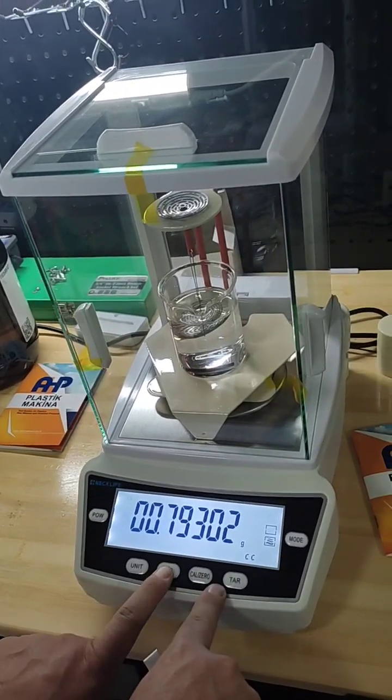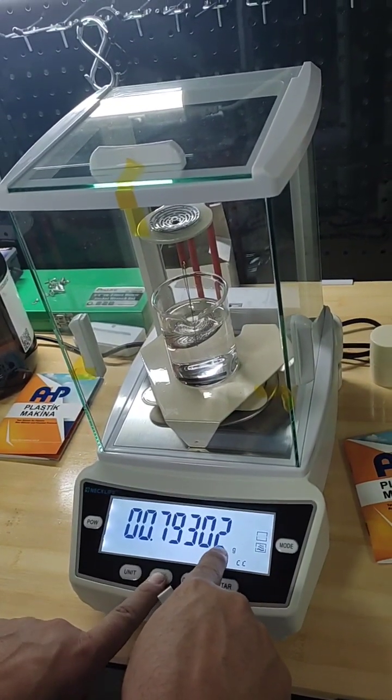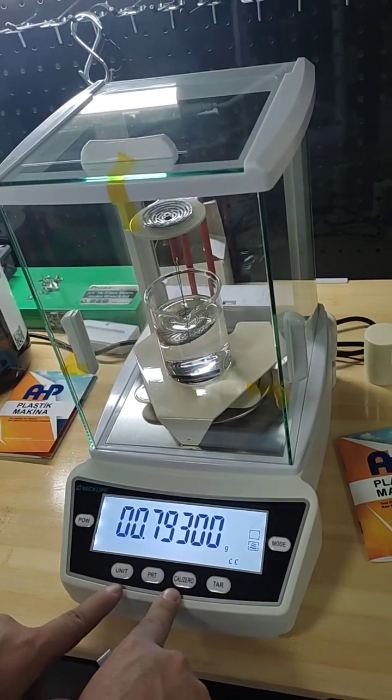0.793 and I want to make this digit to 0. Now this is the density of the liquid.